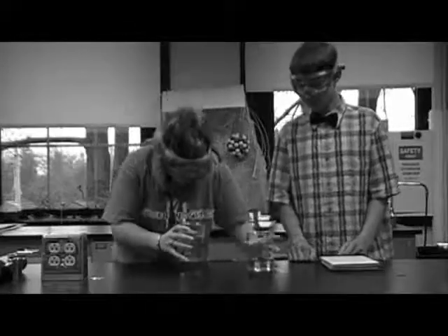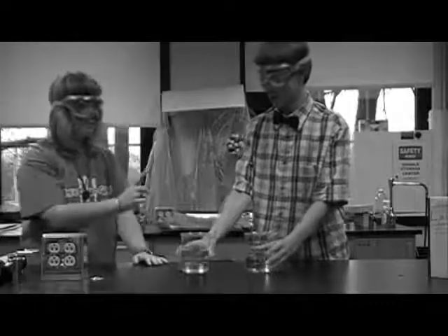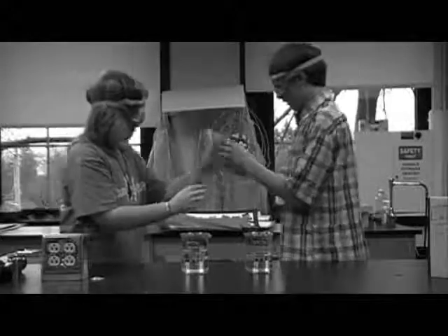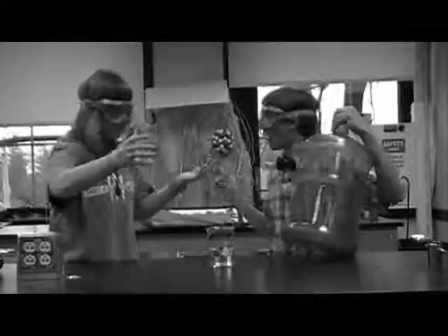Never smell your chemicals directly. Be sure to waft it. Never play mad scientist and mix random chemicals together. Never use broken glassware. You can get a serious injury that must be handled properly. No horseplay in the laboratory. Or anywhere for that matter. Never taste your experiments. Results may be fatal. Always use the correct size container.